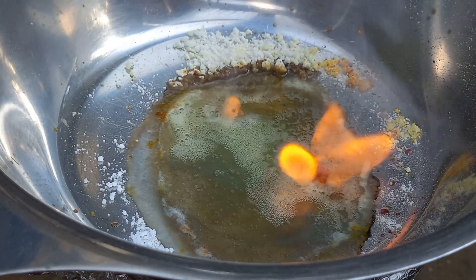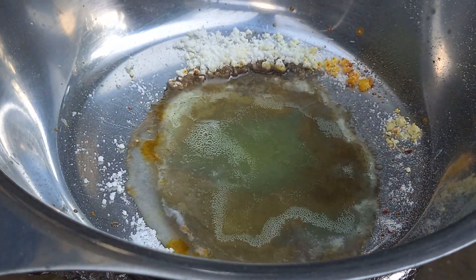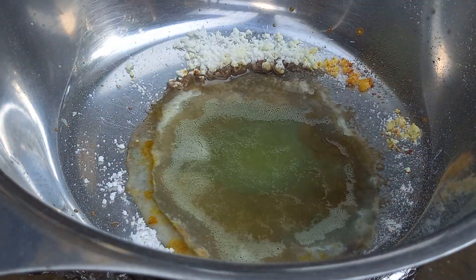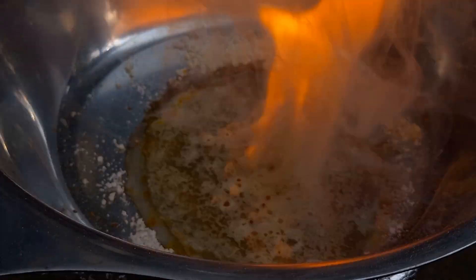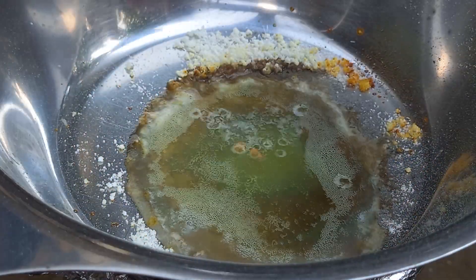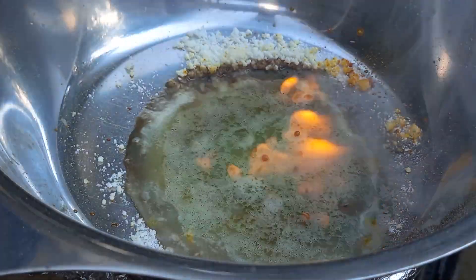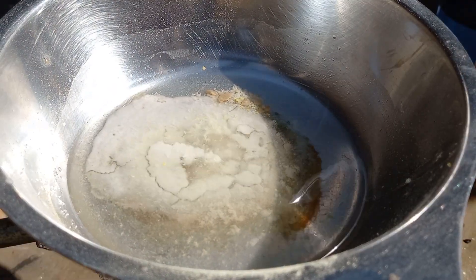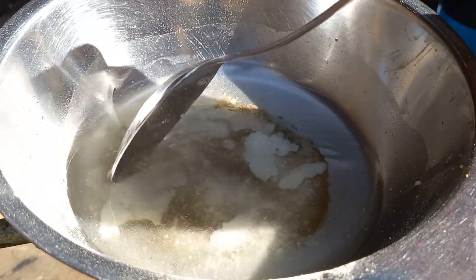Now I'm adding sulfur to hopefully reduce the nitrate to nitrite. After adding all the sulfur to it, I then dissolve it in water and filter it. The sodium sulfate should crystallize out.